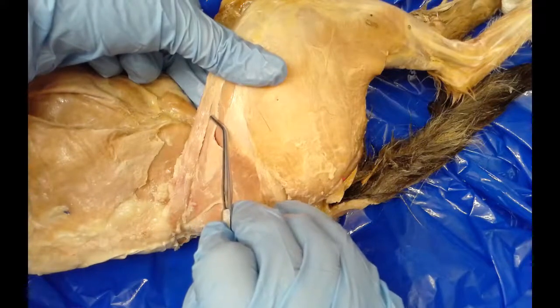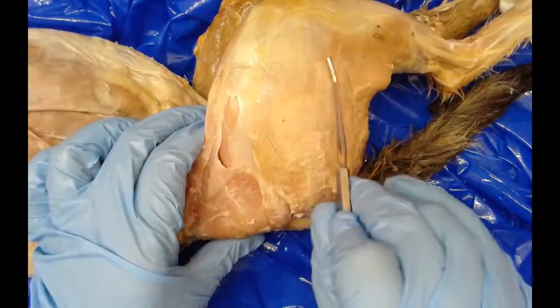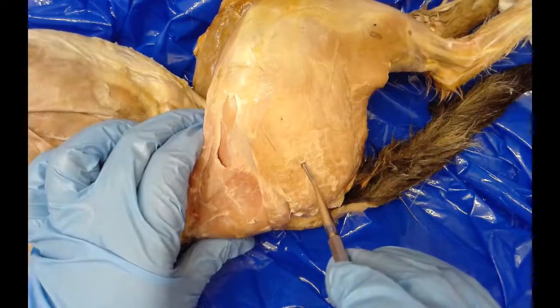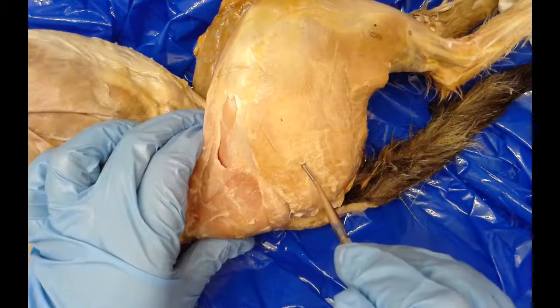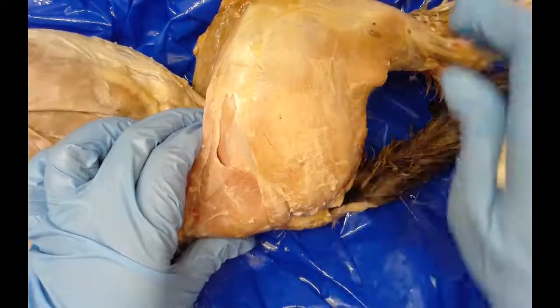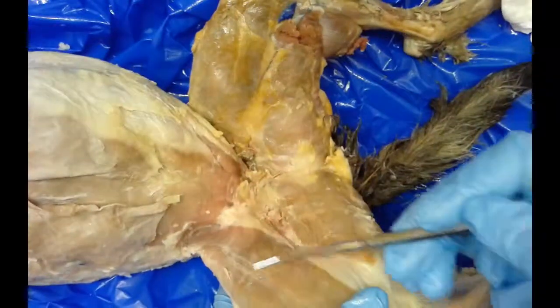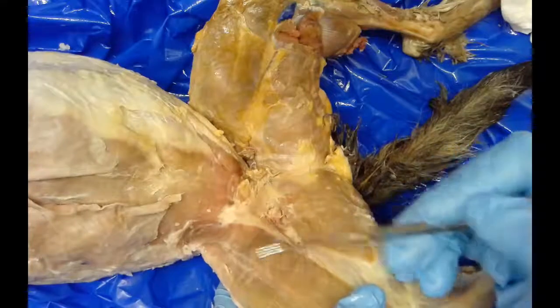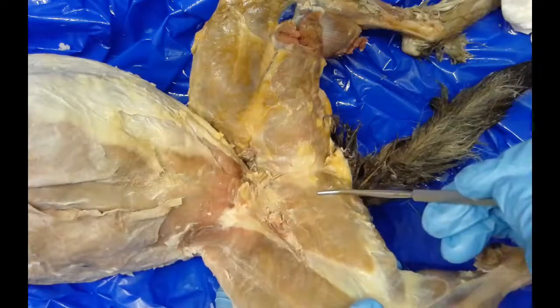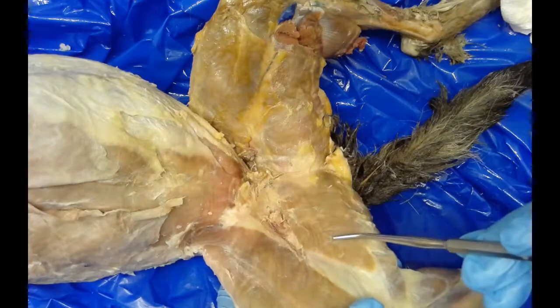On the back of the leg is another huge sheet of muscle called the biceps femoris — very different from the biceps we saw on the front limb. And on the inside of the thigh, back behind the sartorius, is the gracilis muscle, which runs along the inner margin of the thigh. It is responsible for thigh adduction and also helps with knee flexion.